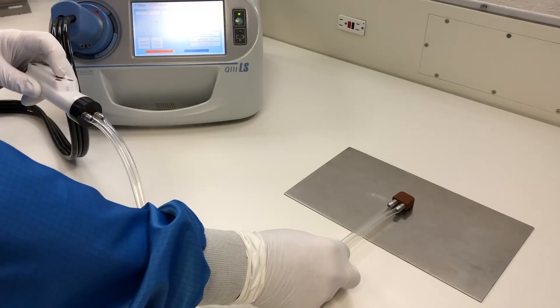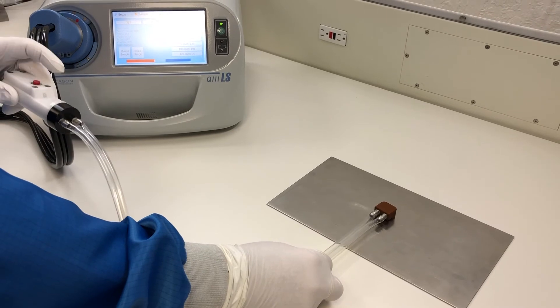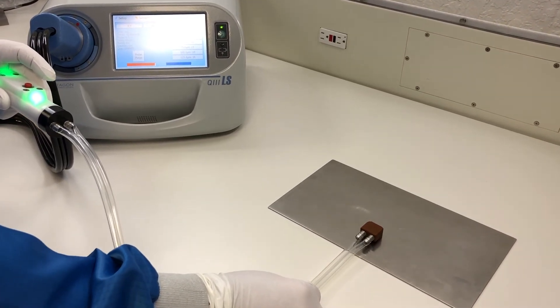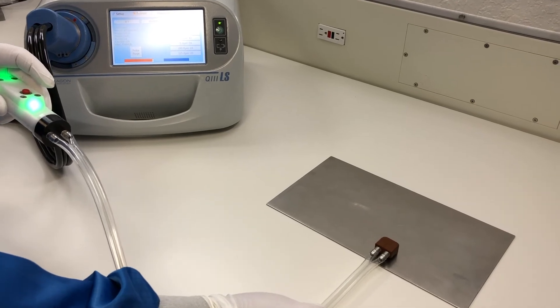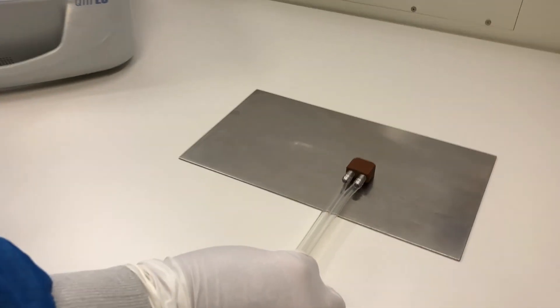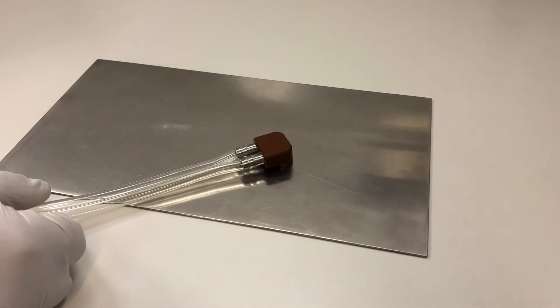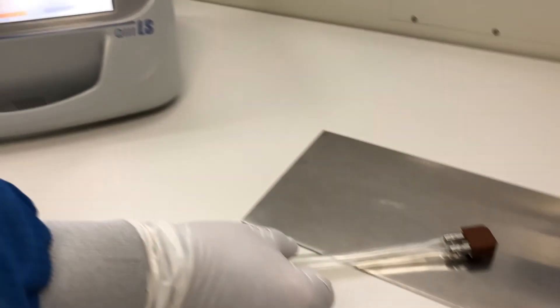By pressing the red button once on the handle and holding the probe lightly on the surface, you can make a measurement. The probe can be held in one place or slowly moved on the surface. The test took 10 seconds and the screen shows the result.